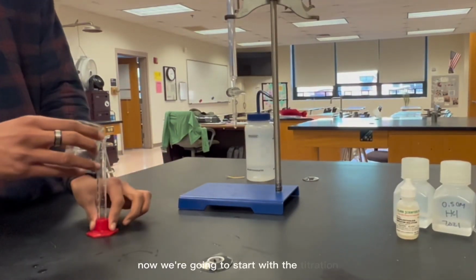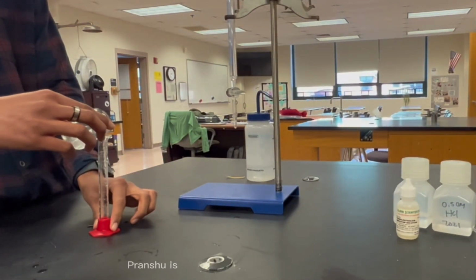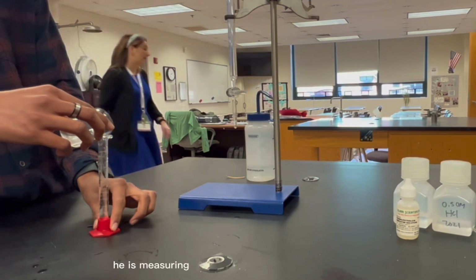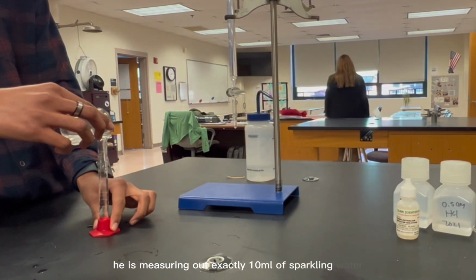Now we're going to start with the titration of sparkling water. Pranshu is going to be proceeding with this titration. As you can see, he is measuring out exactly 10 milliliters of sparkling water.